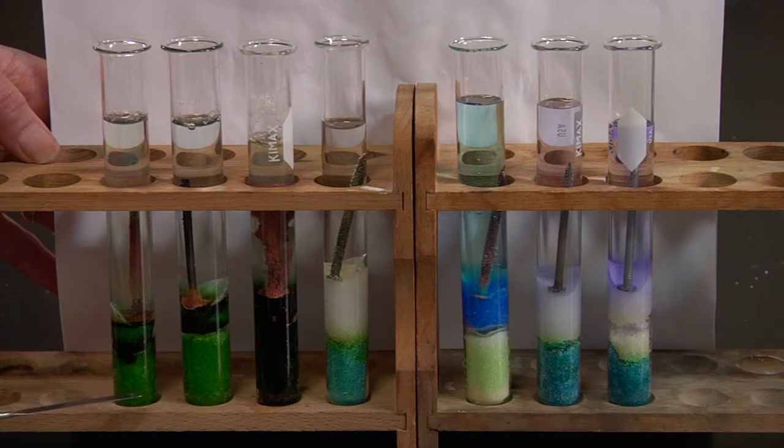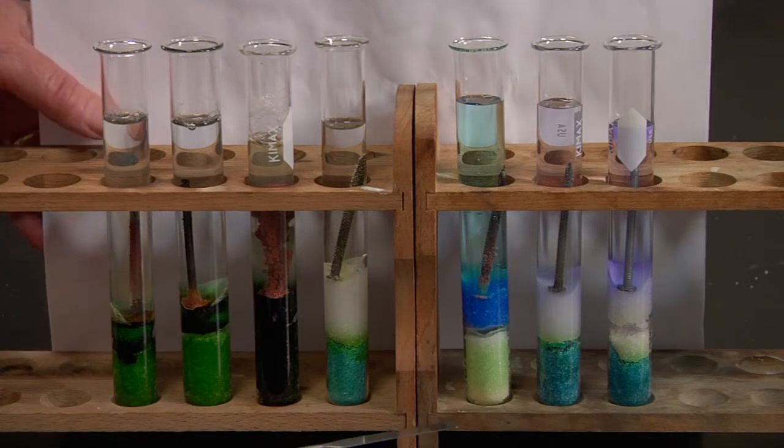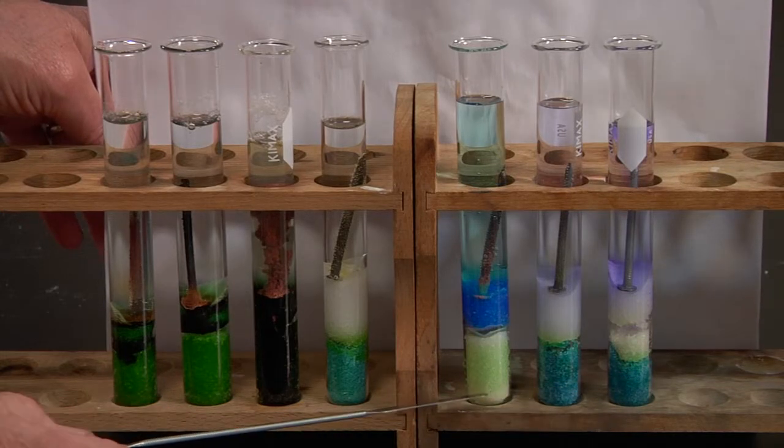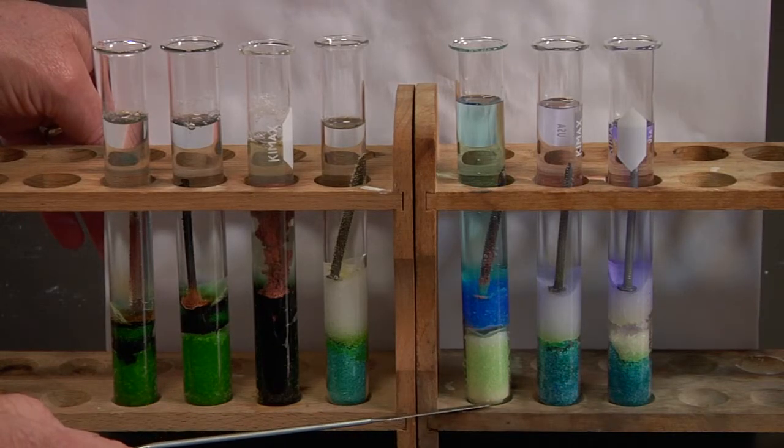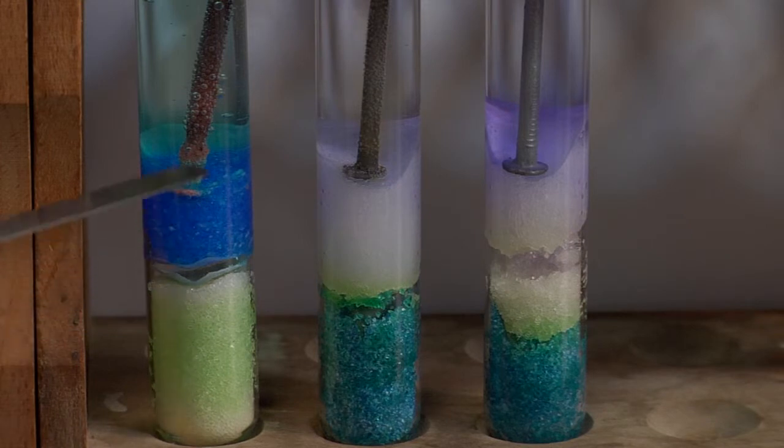Now let's look at the copper sulfate. You're seeing some yellow down here. Where did that come from? Here we see several things that are different. There's yellow at the bottom there. The solution is blue, and here the solutions are slightly purple.